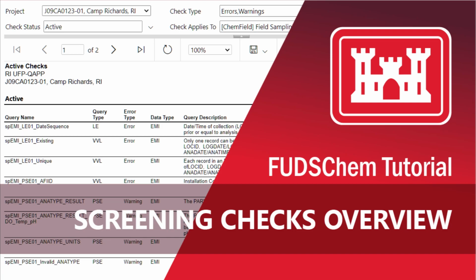This video will go over screening checks in FUDSChem, including how they work, why they are important, and how to troubleshoot a file that has errors.